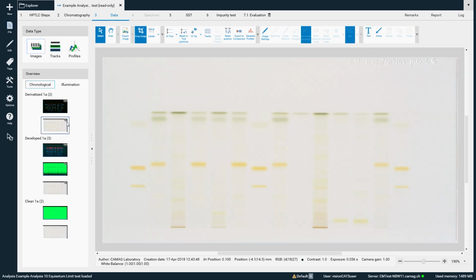visionCATS can automatically compensate for minor shifts or rotations between images. However, in some cases, particularly after derivatization steps, accurate alignment may not be achievable. In such cases, the correction can be enabled manually, but careful visual verification of the result is strongly recommended.